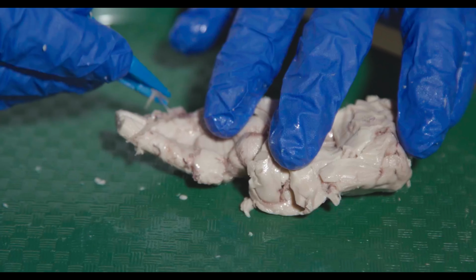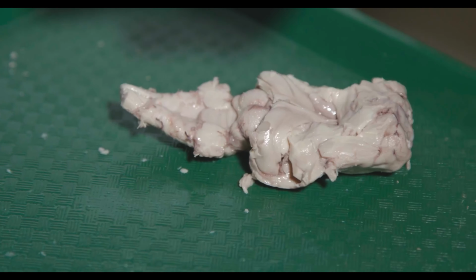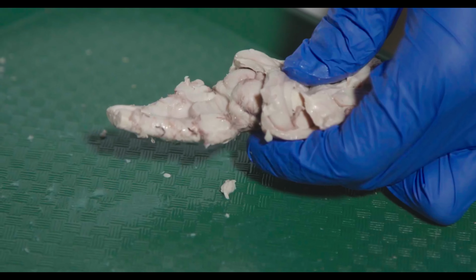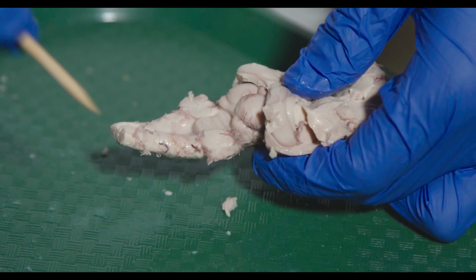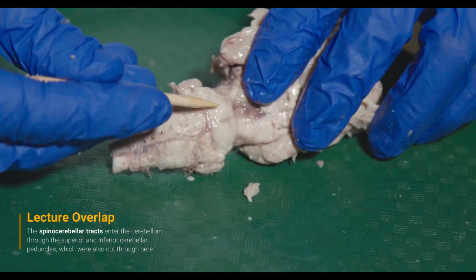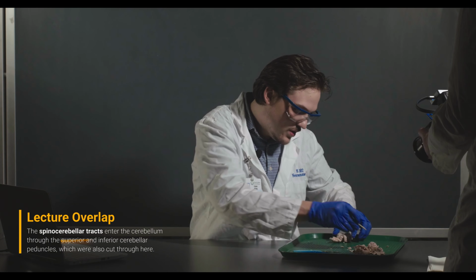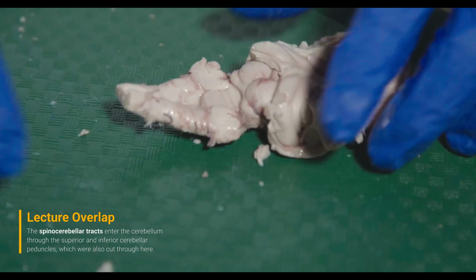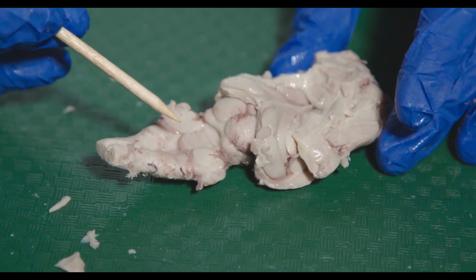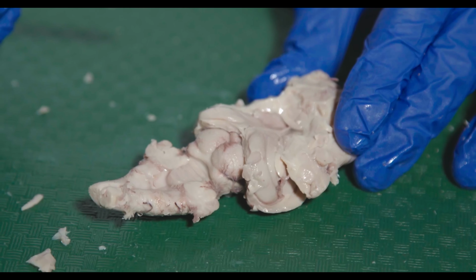So one thing that we talk about in the lecture, if you've gotten to it by the time you're watching this video, is the cerebellar peduncles. The cerebellar peduncles are essentially feeding information to and from the cerebellum. So the cerebellum is just sitting like that. And here are the pons. These actually wrap around to form the middle cerebellar peduncle, which feeds into the cerebellum itself. And I've essentially cut that across. And then the fourth ventricle, again, is right underneath where the cerebellum was. So this is essentially what you want to get to in your dissection if you do it at home.